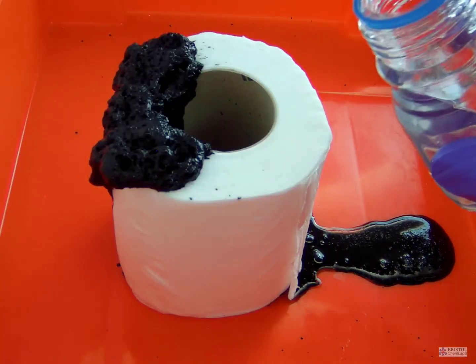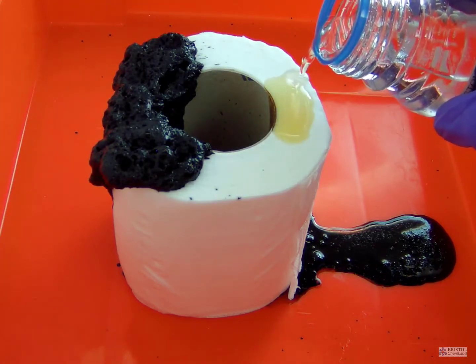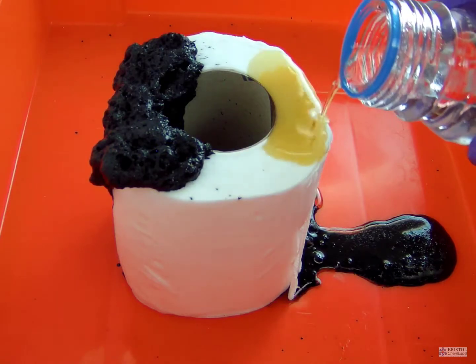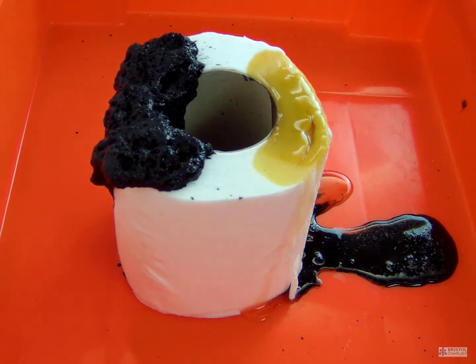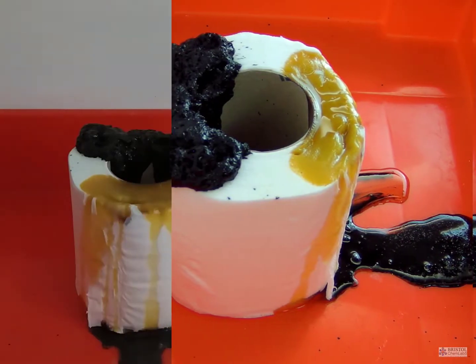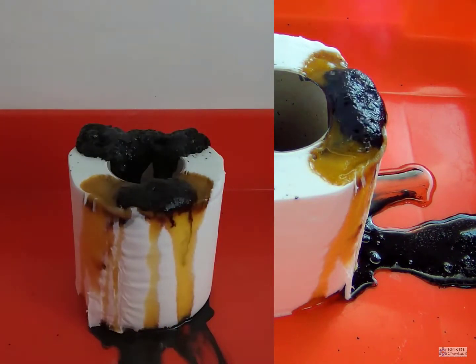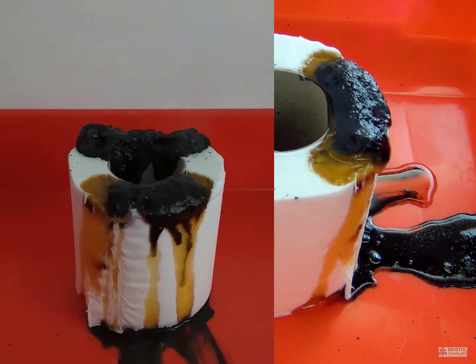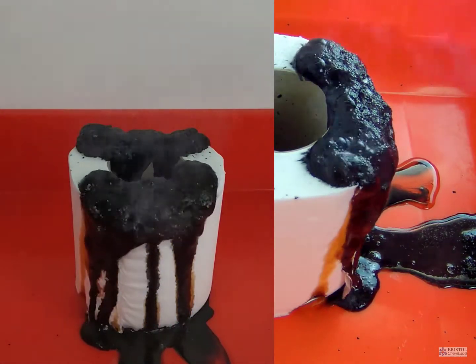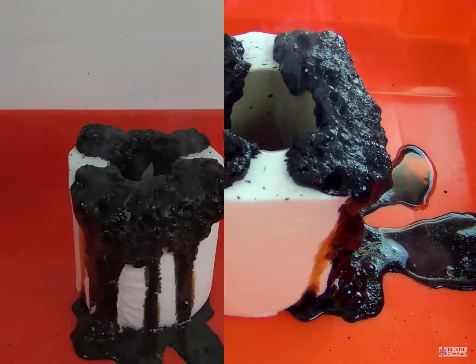The experiment does evolve sulfur dioxide fumes, so you will need to consider whether to do this in a fume hood or in a large, well-ventilated laboratory according to local health and safety regulations. This production of sulfur dioxide is a side reaction and so is not shown in the equation in the earlier part of this video.